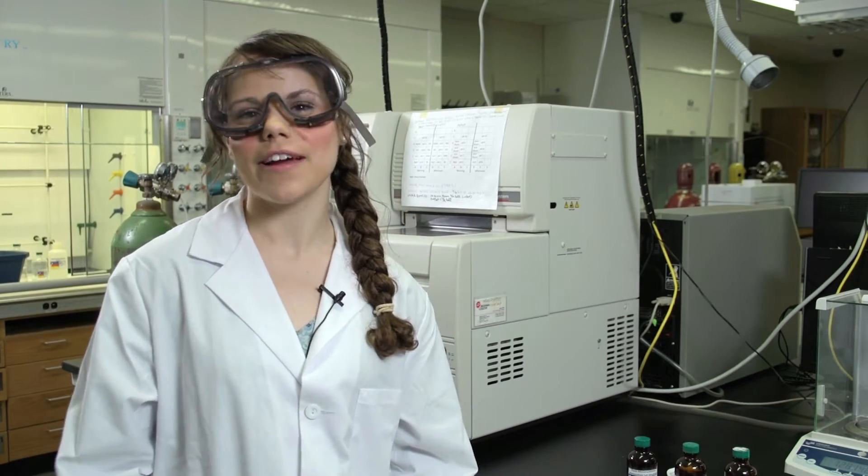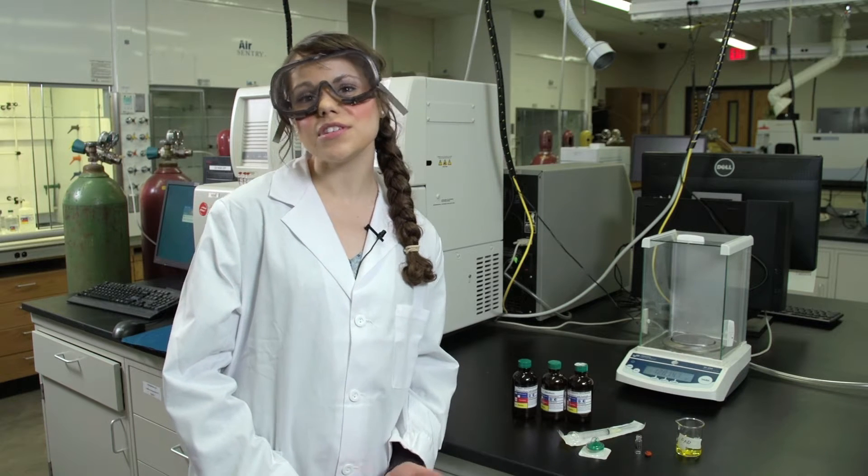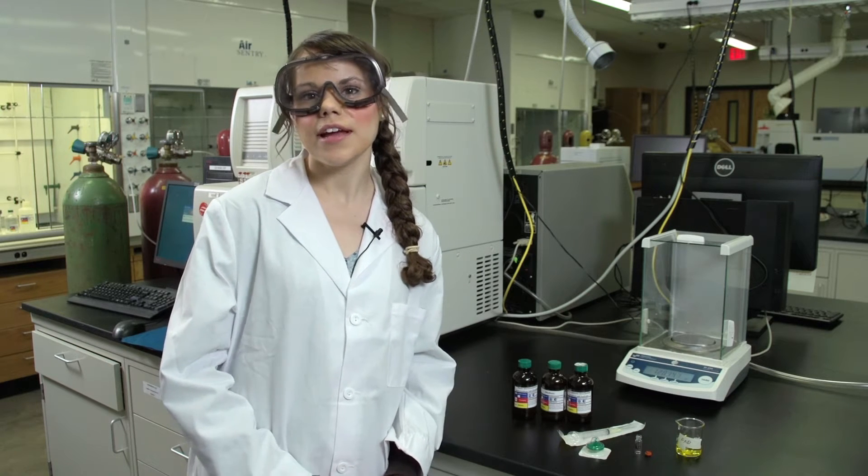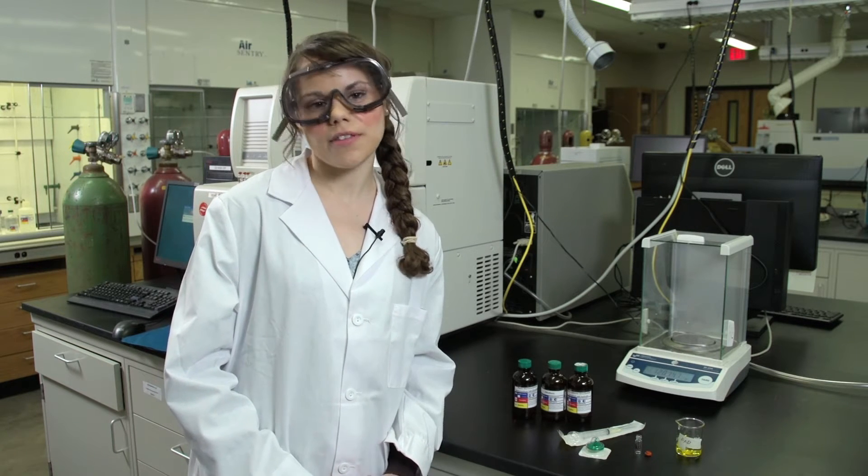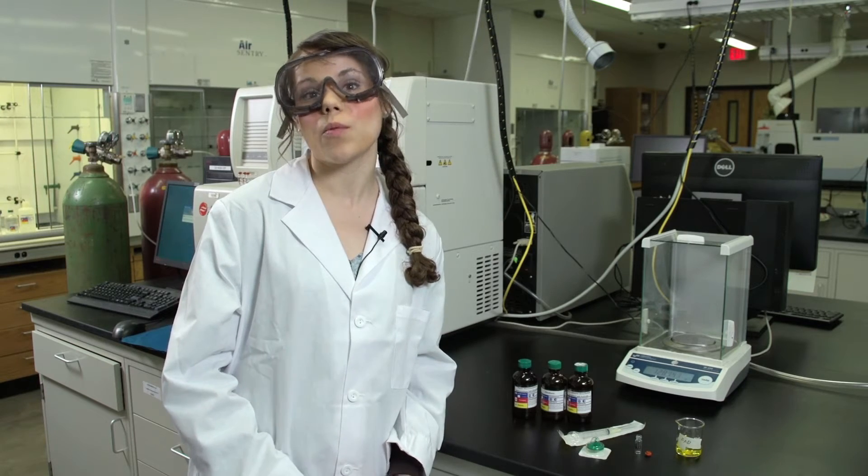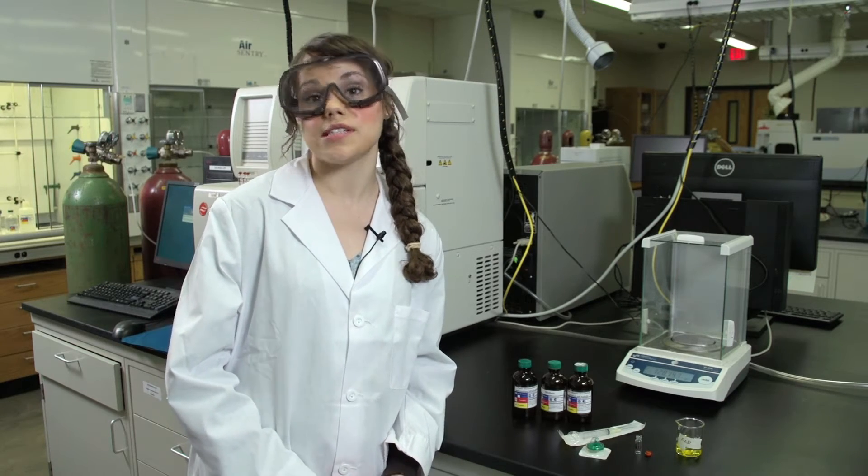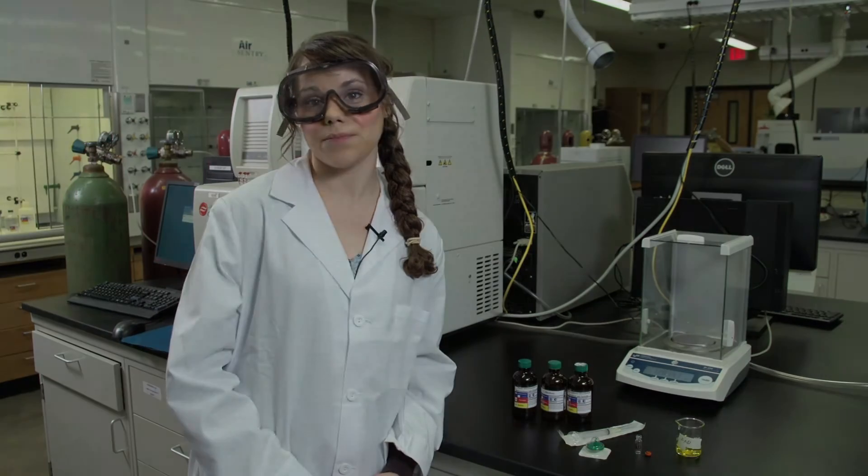In this experiment, you'll be using capillary electrophoresis to separate flavin adenine dinucleotide, riboflavin, and flavin mononucleotide. All the analyte solutions will already be pre-made for you by the laboratory staff. However, when you need to make a dilution in this experiment, it is very important that you use the water that comes from the white tap in the sink, which is the distilled water.